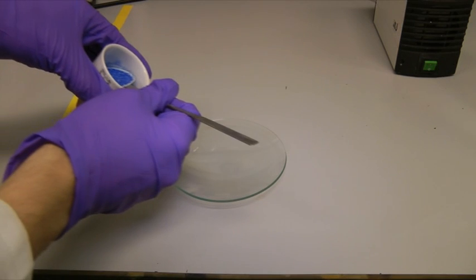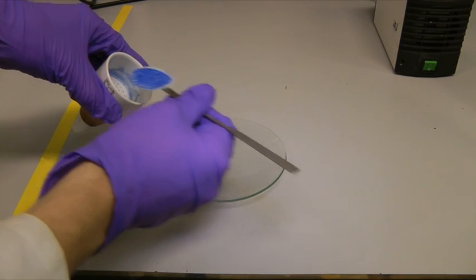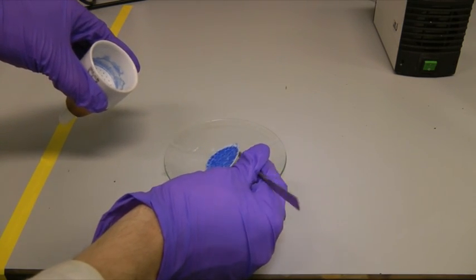Finally, the filter paper and solid can be placed on a watch glass. The solid can then be scraped from the filter paper.